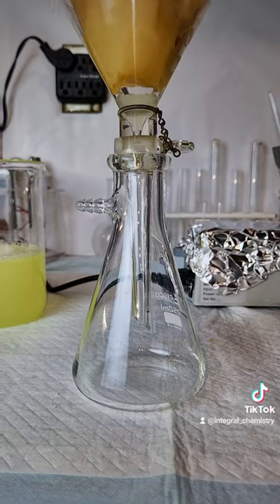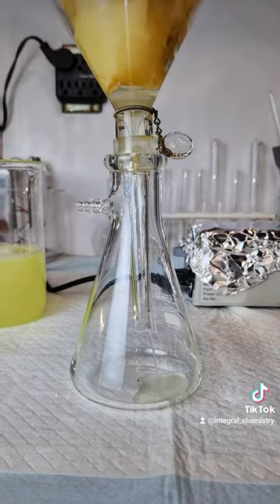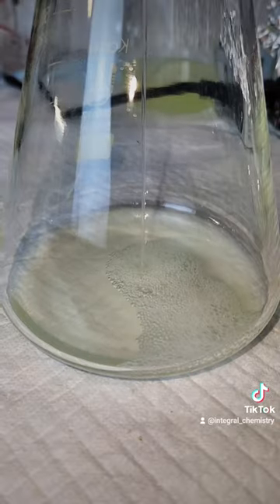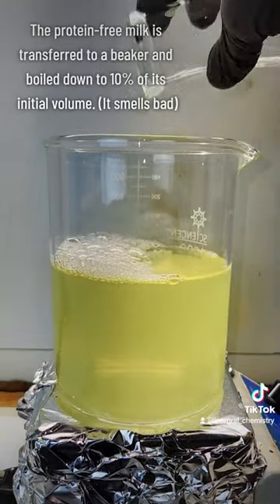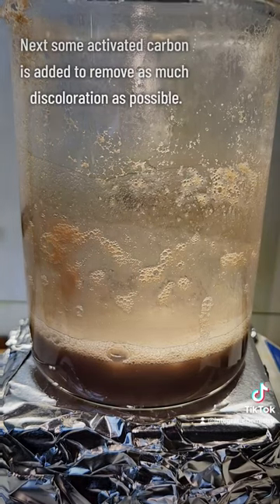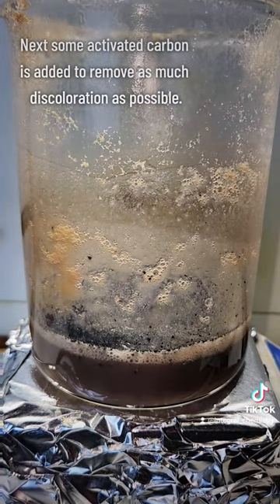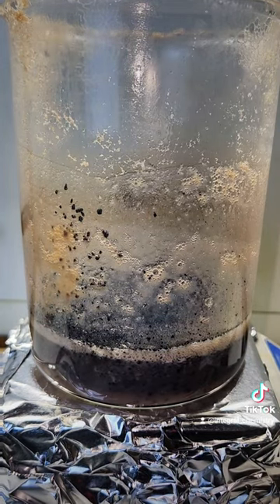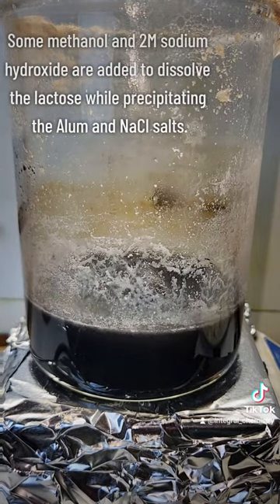Alum is a really good flocculant, which is going to cause the whey proteins to coagulate together so I can filter them off, as you're seeing here. The whey particles are really small, which makes this process take a really long time, so I did try to decant as much off the top as I could before passing the rest through the filter. My final product is this mostly clear yellow liquid, which I then reduce to 10% of its original volume by boiling it. This step of the process smells offensively like a barn, so I next add some activated carbon, which gets rid of the smell as well as a lot of the discoloration caused by the reducing process.